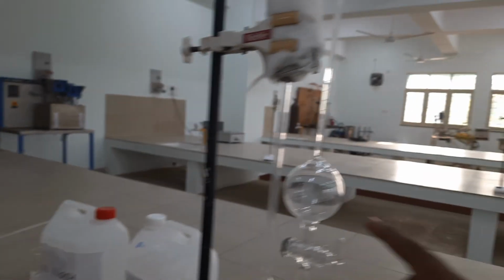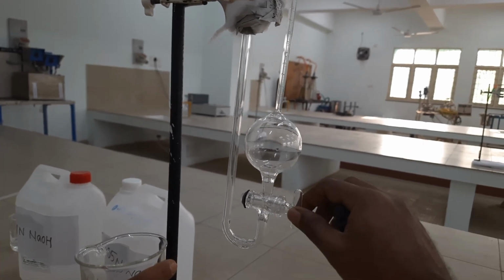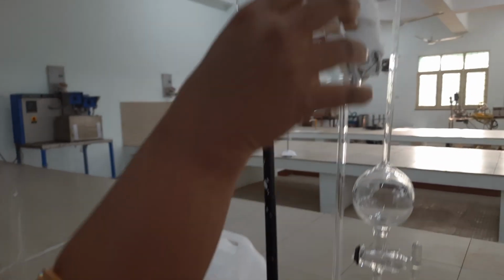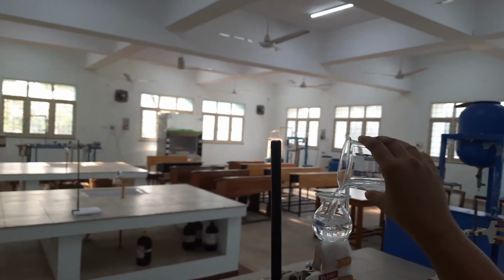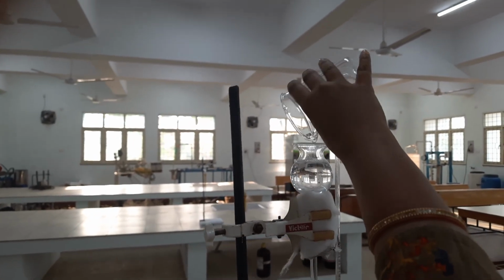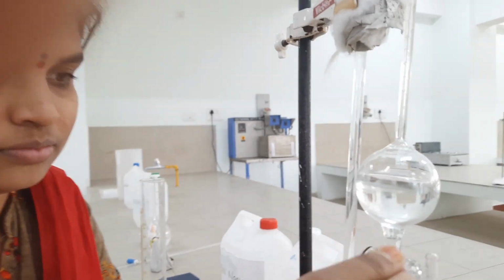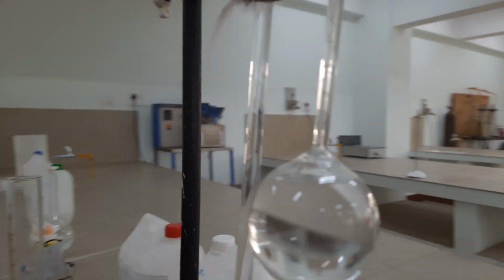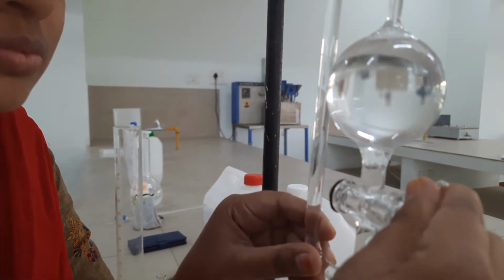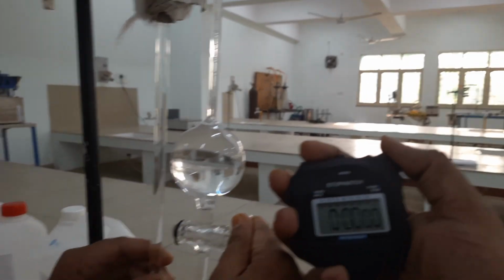After mixing, we pour this mixture into the dilatometer, for which we first have to open the valve completely. The mixture is being poured on the left hand side of the dilatometer. Once the mixture reaches zero reading, we close the valve completely. We also have to make sure that no air bubbles remain in the whole system.